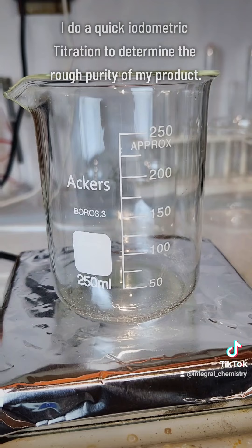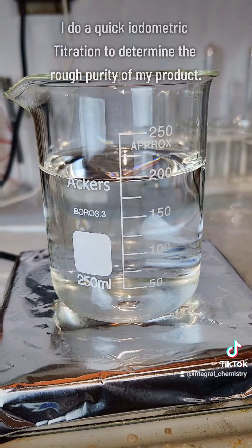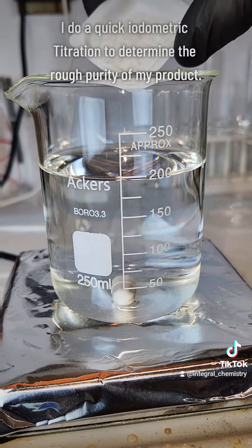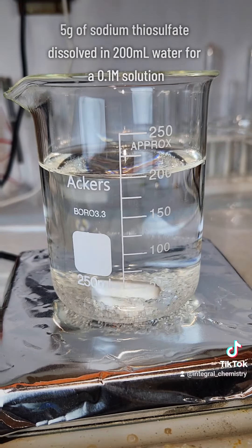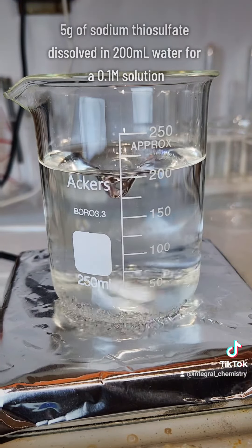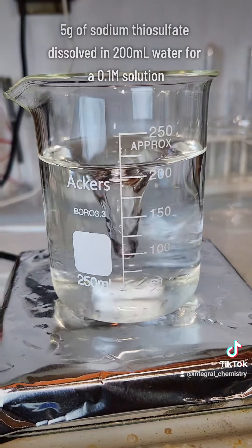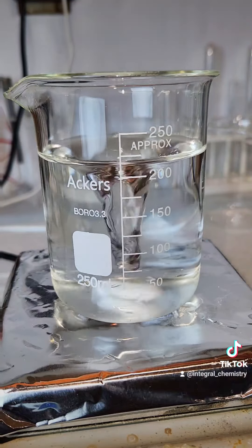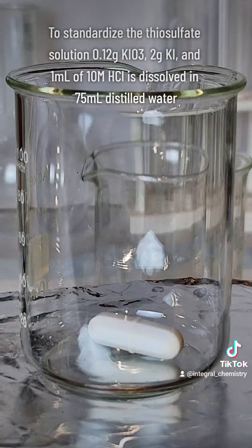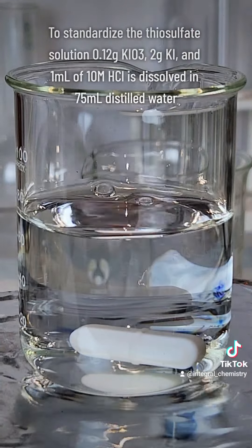As a fun little final step, I decide to do a quick iodometric titration to determine the rough purity of my final product, and I begin by dissolving 3.16 grams of sodium thiosulfate in 200 milliliters of water. I know I wrote 5 grams, but it's a typo that I can't fix now.